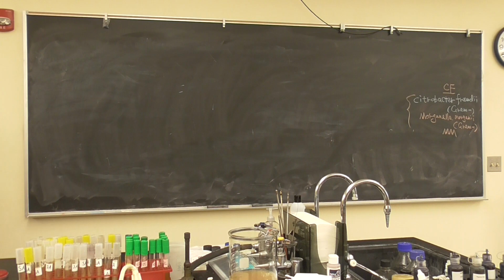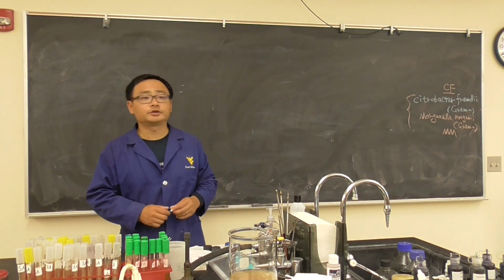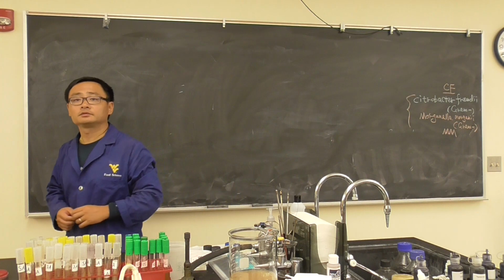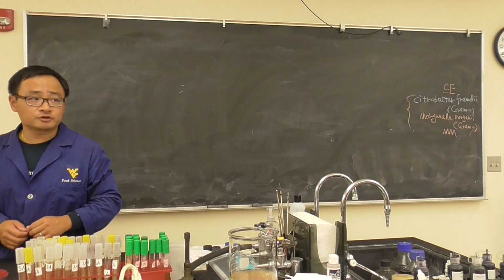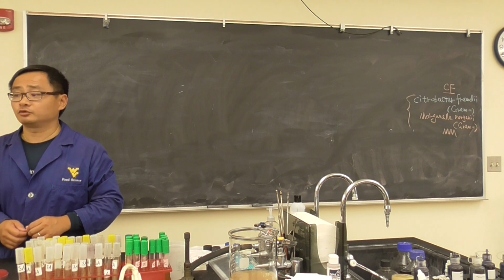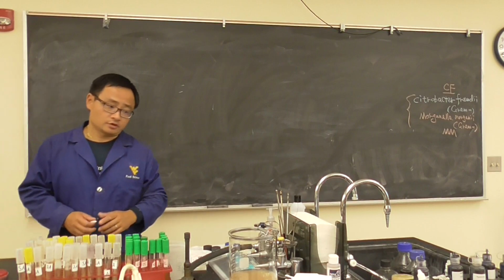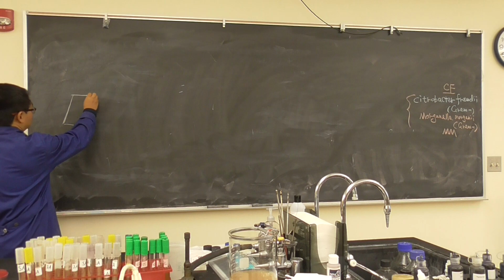Okay, so first of all, everybody look at your pour plating results. That looks okay? Not very good, is that right? So you see the difference between pour plating and spread plating. Now, what's a major reason? When you have this jar right there, let's say this is a jar or something.